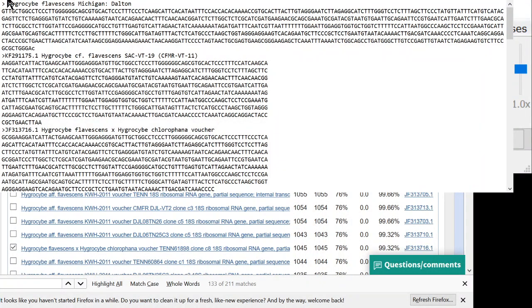And now we have to save this as a .fas. If we just save it as a text file, that's going to make the other programs think that it's not a FASTA file. So this is hygrostomi.fas. And now we have our FASTA file.